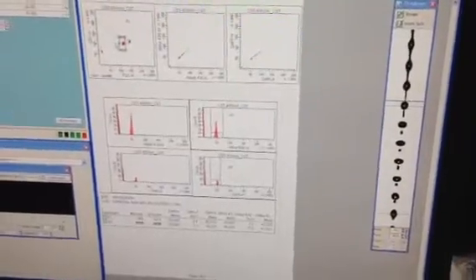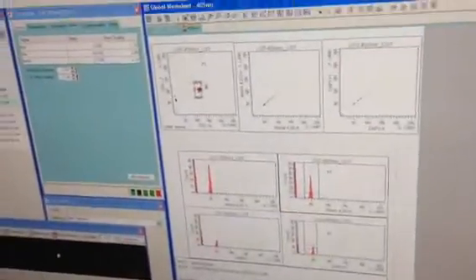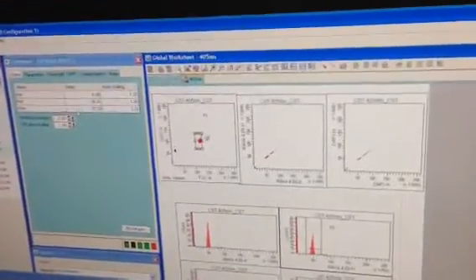So do you ever change, way back we used to change the window extension to 0? We change the window extension to 0 when we are actually setting the laser delays. I didn't show that earlier, but you're right. That's what we would do. That is correct.